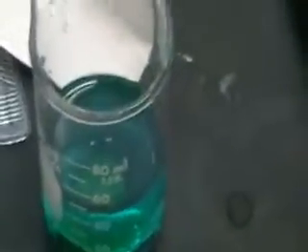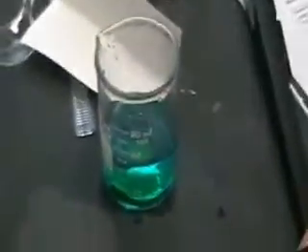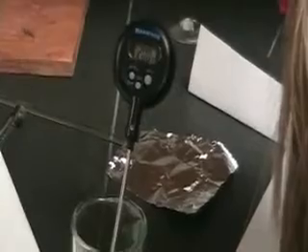You put the copper chloride in the water — what happens? It turns neon green, and then when you stir it, it turns neon blue. There's aluminum foil — silver and shiny. This is after stirring. Now it's blue, look at it. It turns blue.